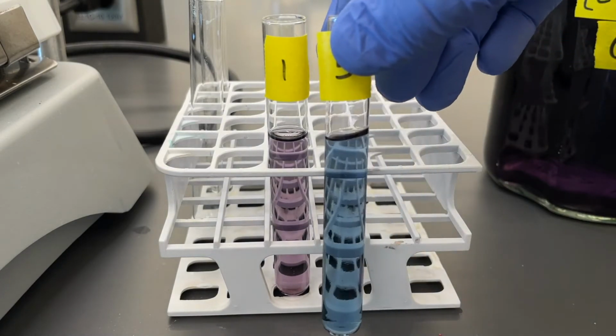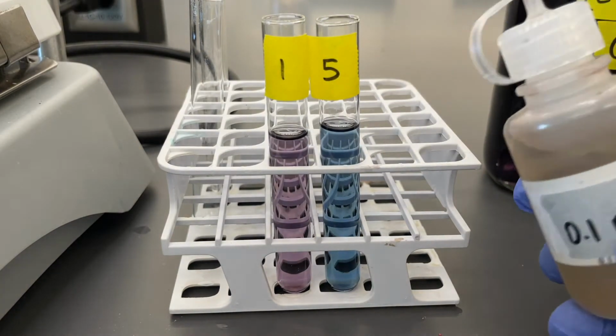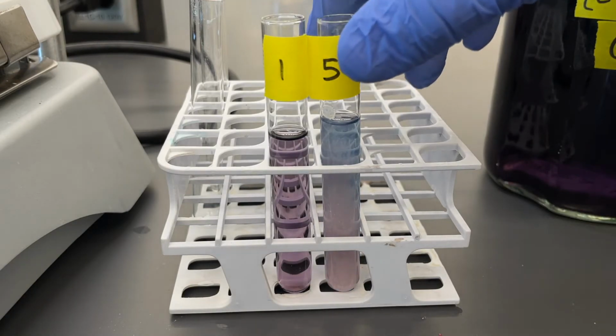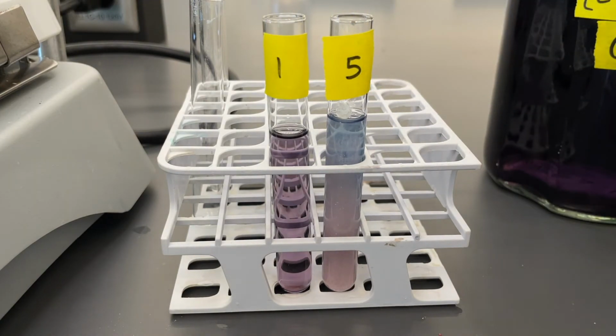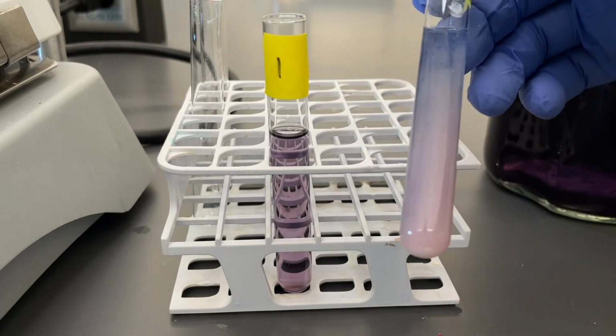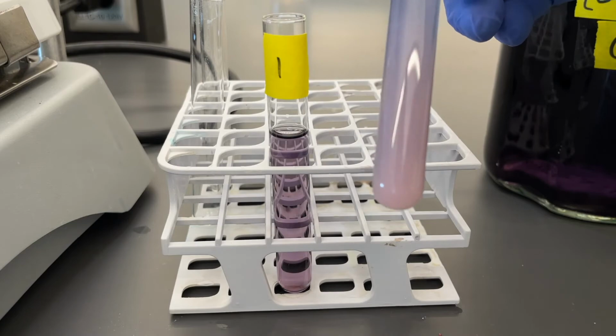Give it a quick little shake. Obviously, again, make that color comparison. And then we're going to add about 10 drops of our 0.1 molar silver nitrate to this one. So now what's different about this one as compared to the other ones? We can see that it's formed a gradient there, and it looks a little cloudy with some salt falling to the bottom of that test tube right there.